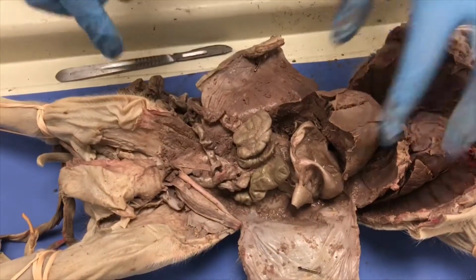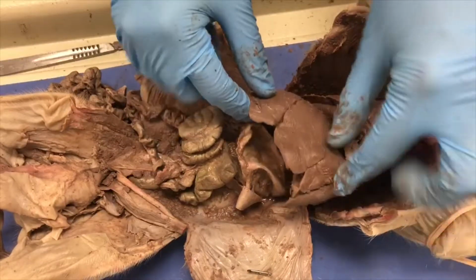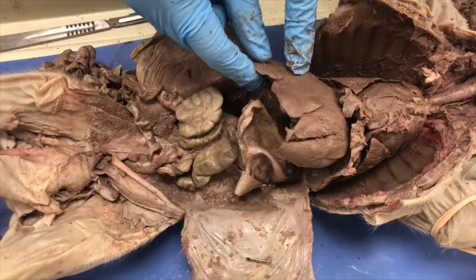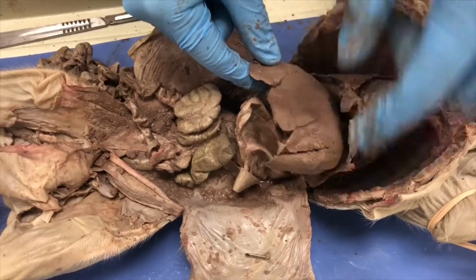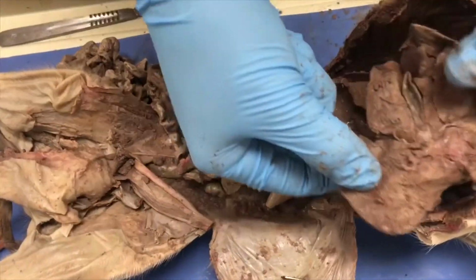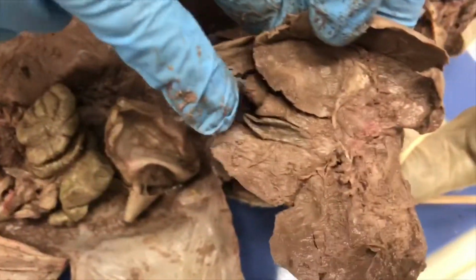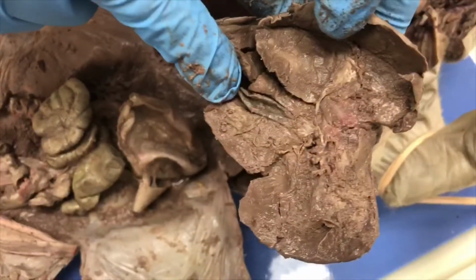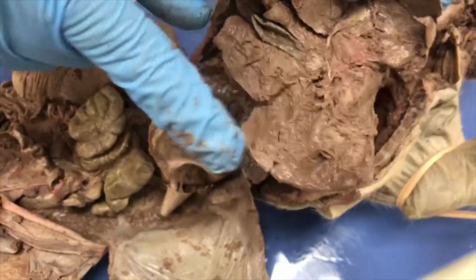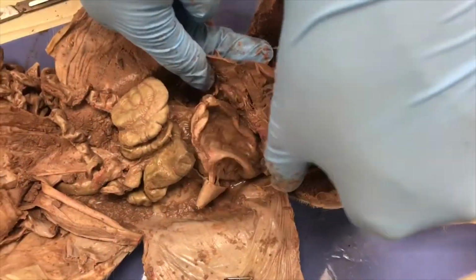Okay, and then we have the liver, which is right here. It makes bile to break down fats, also filters poisons and drugs out of the blood. We have the gallbladder that's next, and the gallbladder is going to be right under the liver, inside of it, which is that right there. The gallbladder also stores bile and releases it as needed into the small intestines.